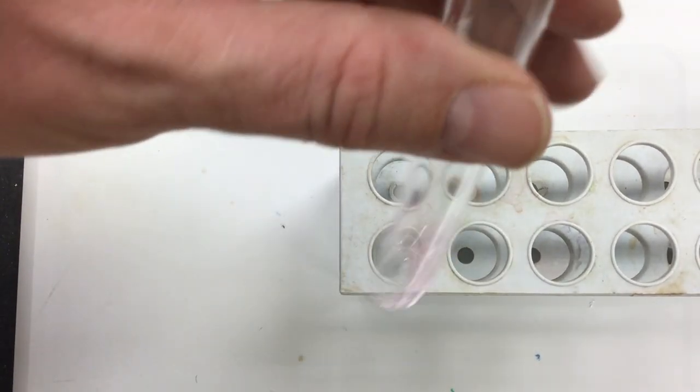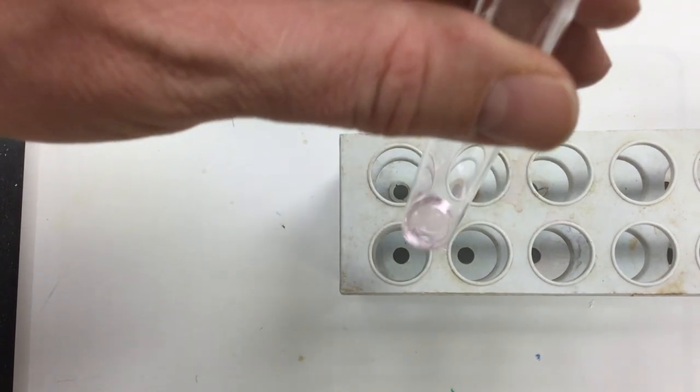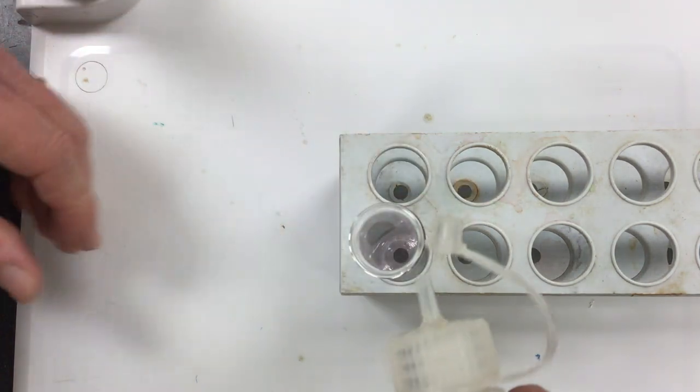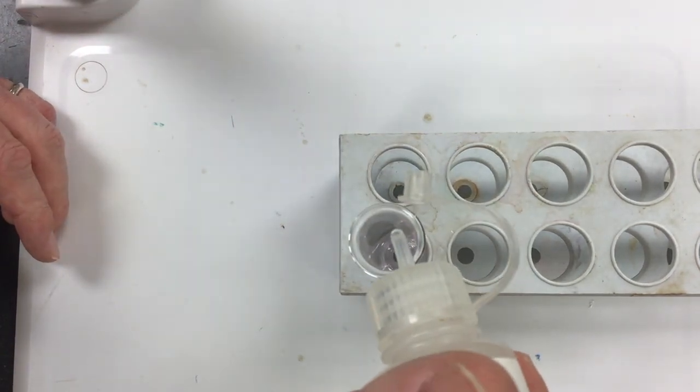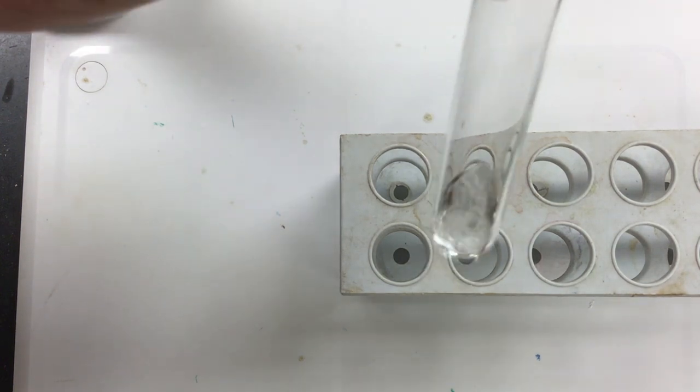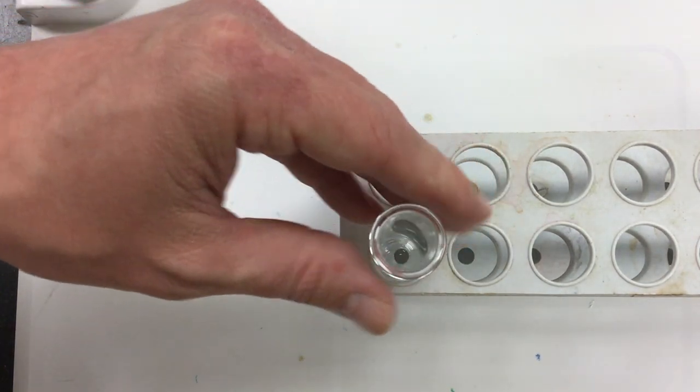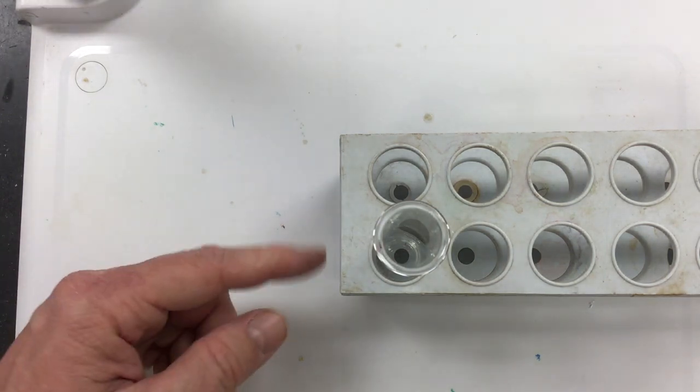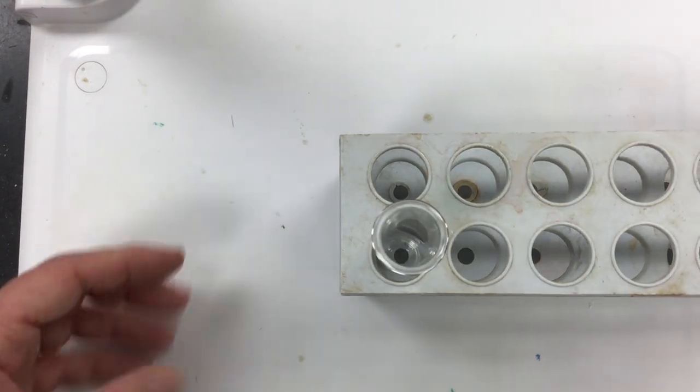Hasn't changed yet, exciting experiment. Twelve, nope still pink. Thirteen, there it goes. Thirteen is pretty much right at the money. It's still slightly pink there. I bet if I went one more to fourteen, it would be completely clear. There we go. So fourteen drops of my hydrochloric acid was enough to cause this guy here to change. So we're going to go with fourteen.